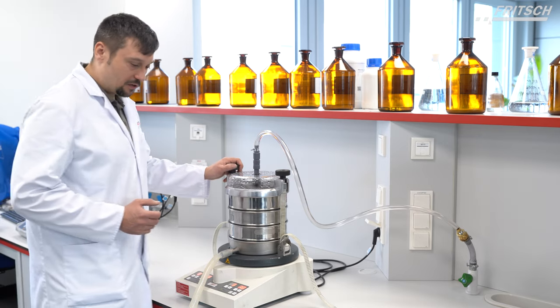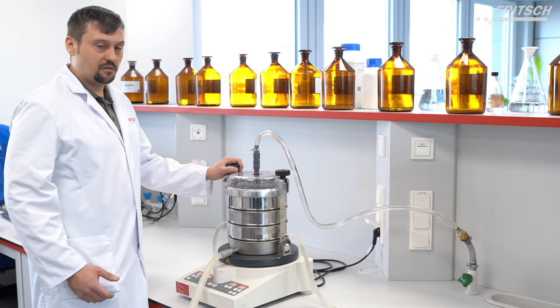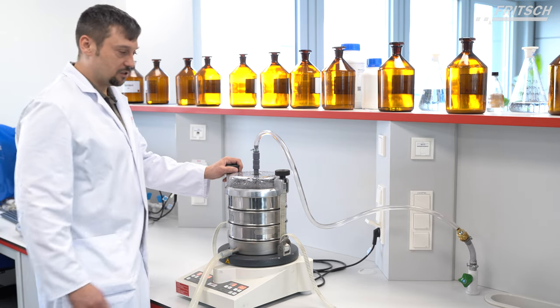Now we can close the water supply and inspect the sieve to see if the sieve procedure is finished.